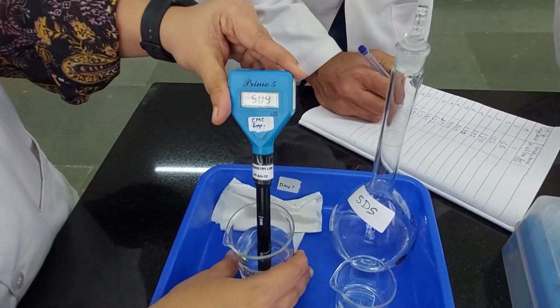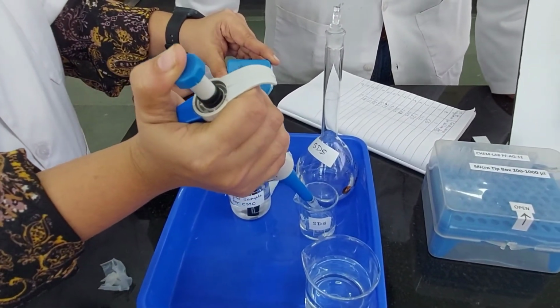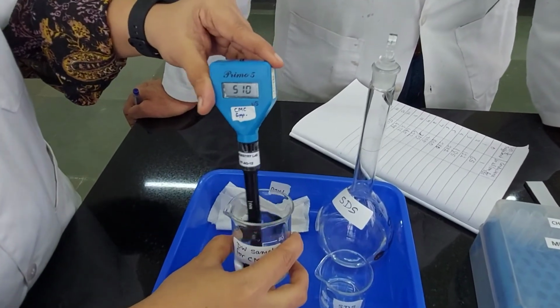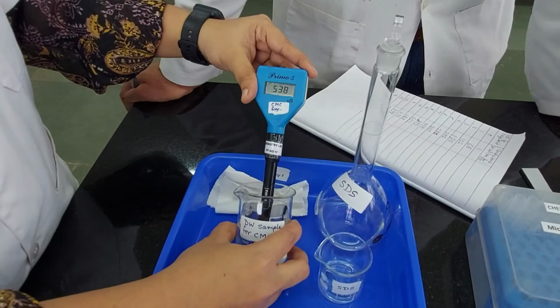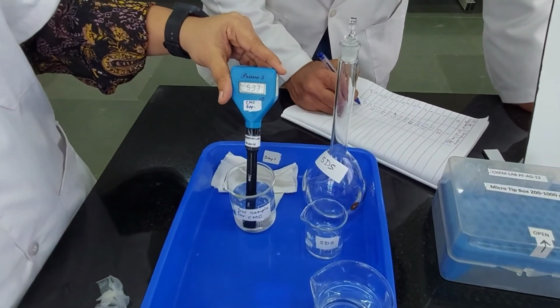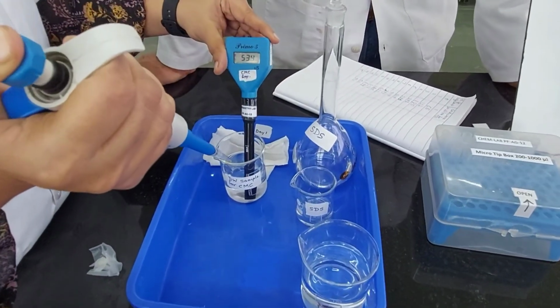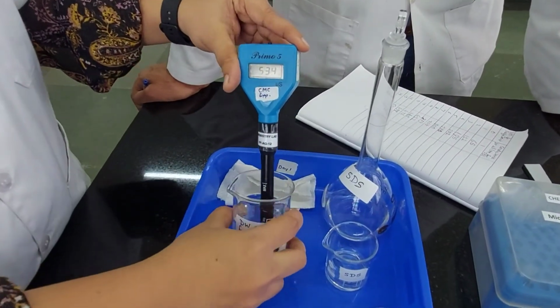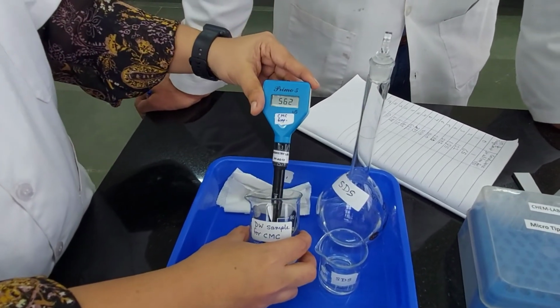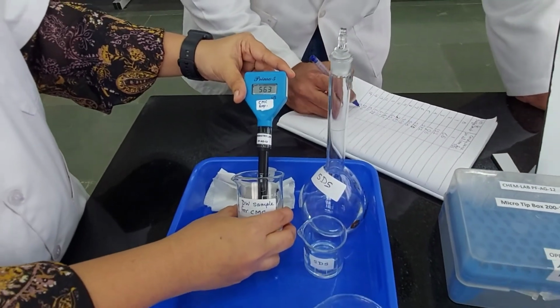521. Now the other readings, as I said, the water has also been measured along with the other ions, and then we will be using those readings for our calculations. But by all means you can use this. That's 540, right? And the last ml, the 15th ml, has to go in now. So in goes the 15th ml. You stir it a bit, and measure the reading. It is 563.